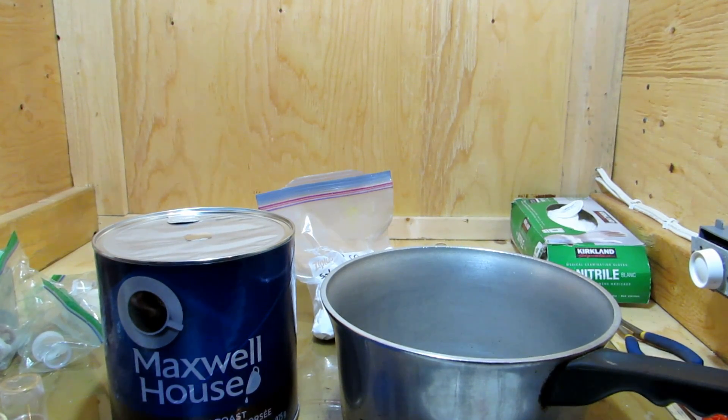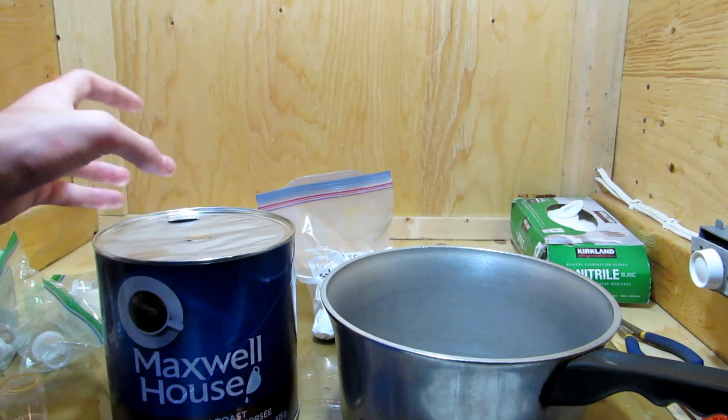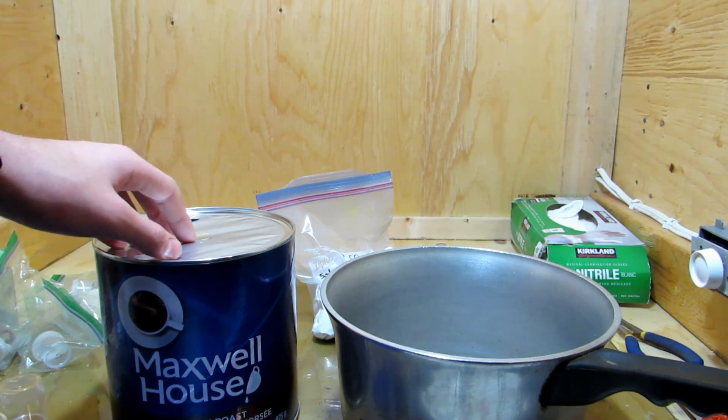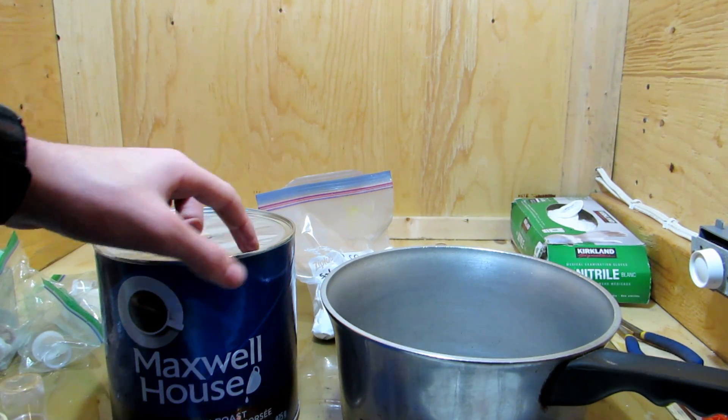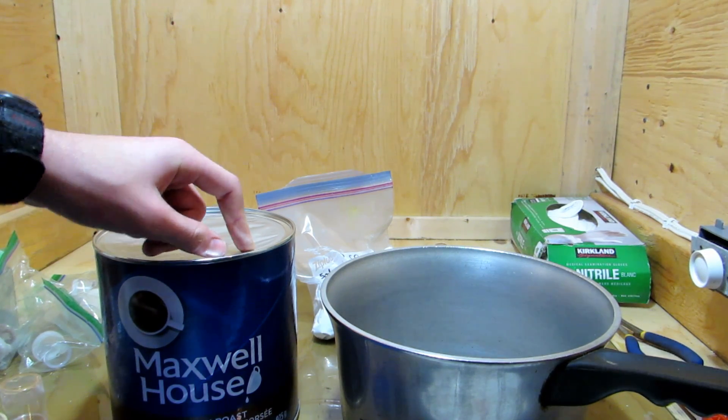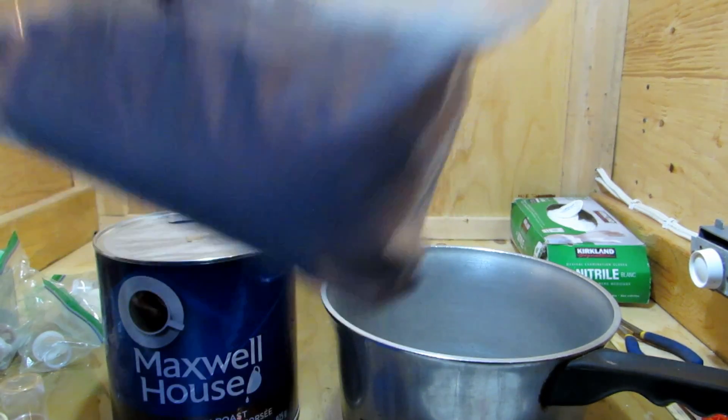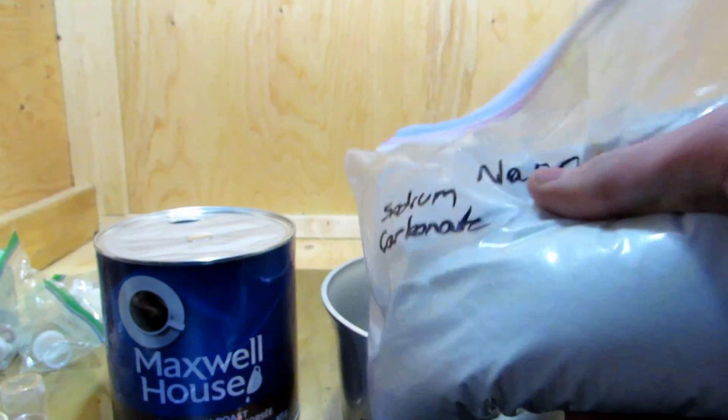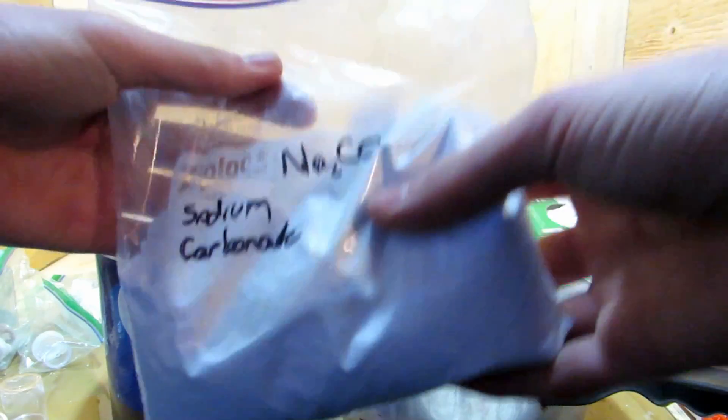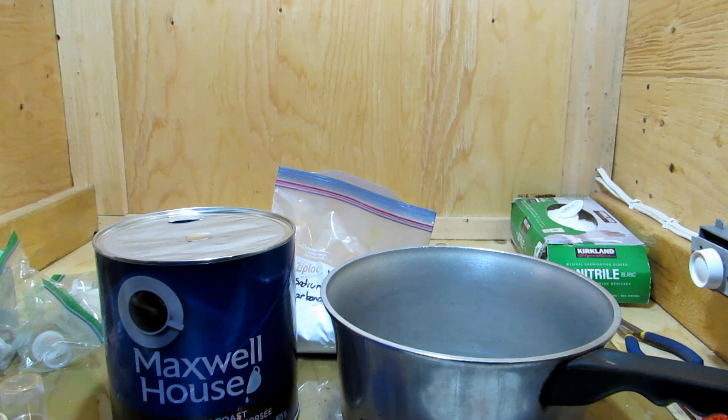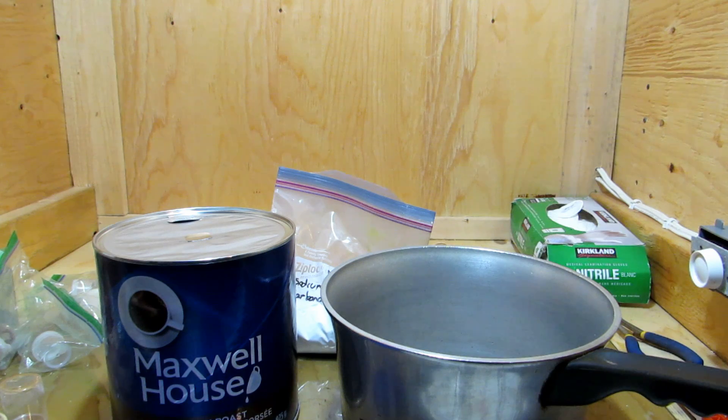There's really only a couple of materials that we need. We're going to need some dichloromethane, which I haven't grabbed quite yet. Of course we need coffee, not decaffeinated because we want the caffeine. And we'll also need some sodium carbonate. This is kind of optional, but the sodium carbonate will help by increasing the solubility of caffeine in the solution.